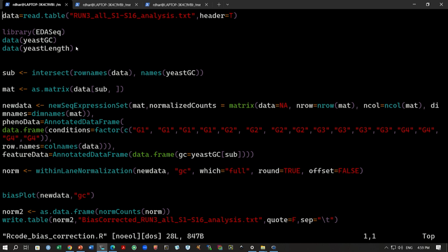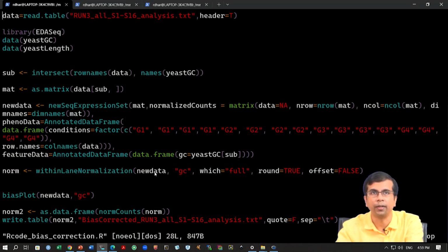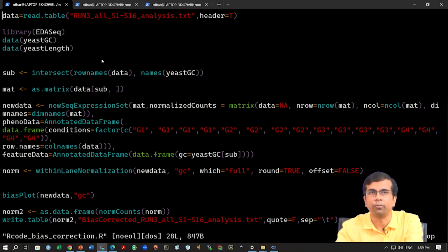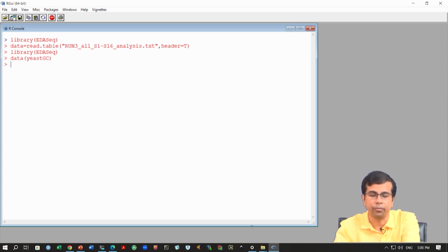Okay. So, let us run this. Okay. So, the first thing is we load the data afresh, right, in this data variable. Maybe we have loaded already, but I just want to run this again, make sure we have everything in order. Okay. So, this data is here. The next part is to load this library and this data, two data sets. Okay. So, first we load the library EDASeq, then we get these two data that we will also load. Okay, data yeastGC and yeastLength. Okay, yeastLength is probably not required for this hands on, but anyway we can load library EDASeq. Okay, and then these are the data that are present in the EDASeq library. Okay, so we can simply load the yeast data, and that we will use for our analysis.